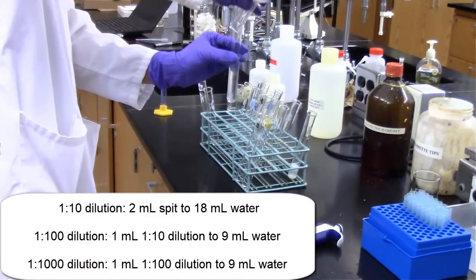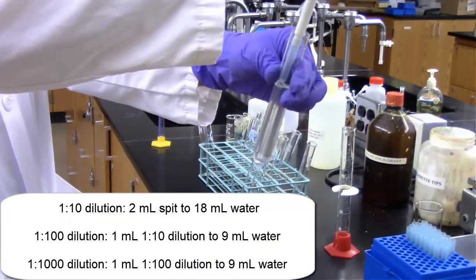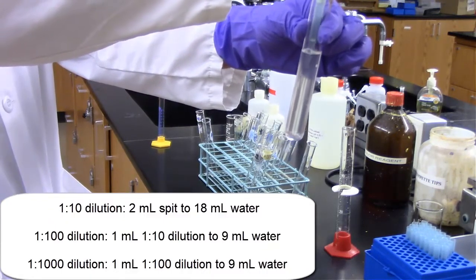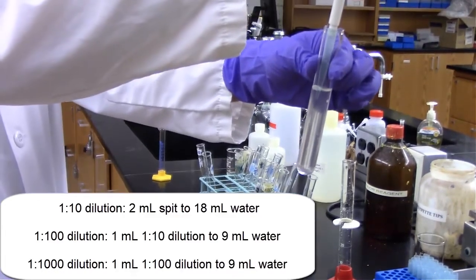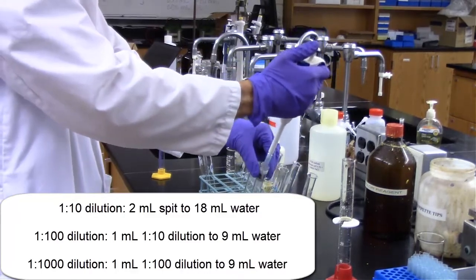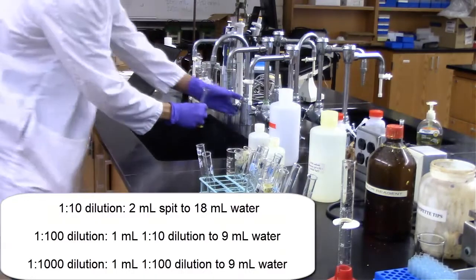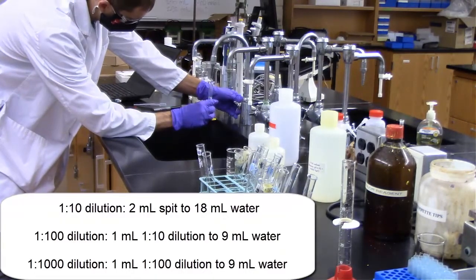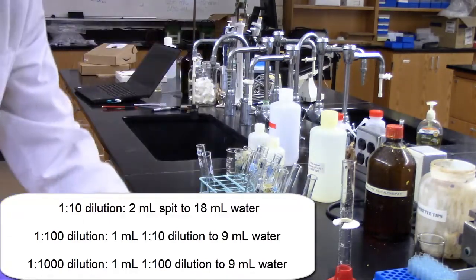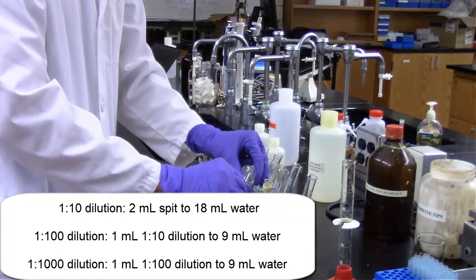So 1 part of the reagent is 1 milliliter of my spit. Add 9 milliliters of water to that, you have 10 total, so that's the 10 parts total in the 1 to 10 dilution. For the 1 to 100 dilution, we're going to take a milliliter of the 1 to 10 dilution that was made, put that in another test tube, and dilute that with 9 milliliters of water. So we're taking 1 part 1 to 10 dilution, diluting that with 9 milliliters of water, otherwise known as diluting that tenfold, to make our 1 to 100 dilution.